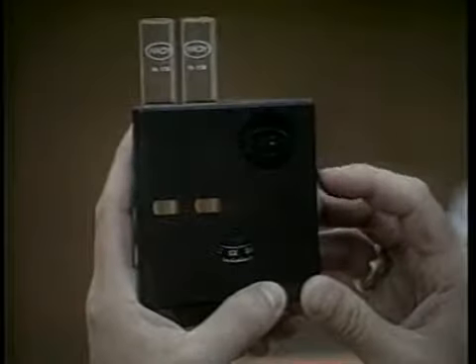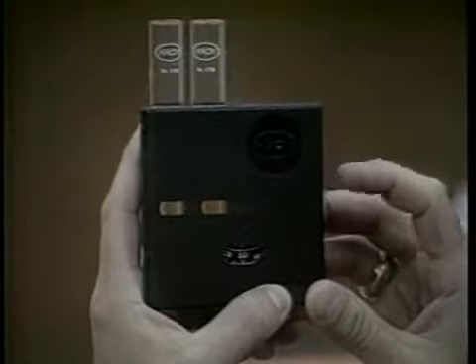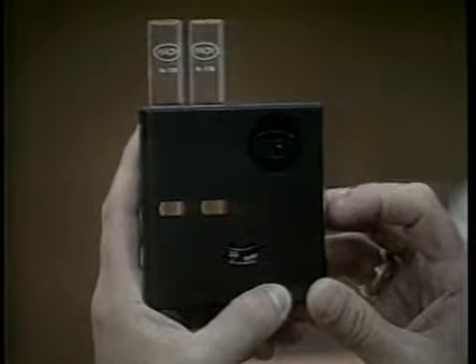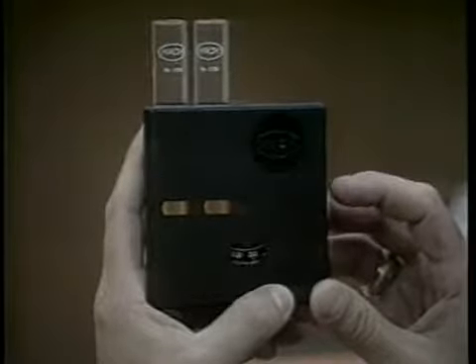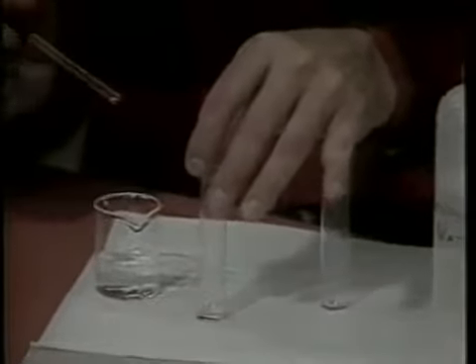If the reading on the wheel is greater than 2.8, or 90% of the maximum, it is necessary to perform a dilution of the sample so that the reading is within the color range which will be detected by the color comparator. A 5-fold dilution generally solves this problem.